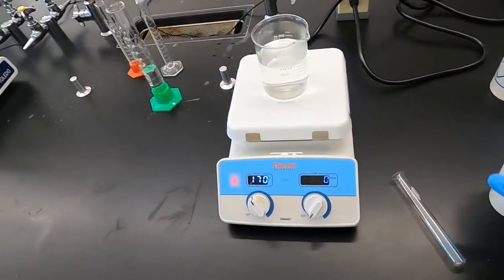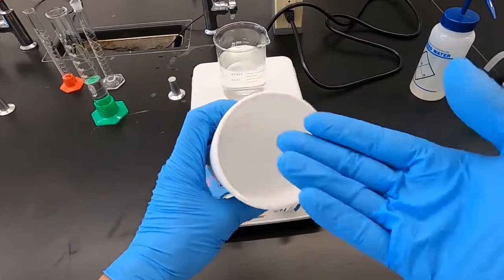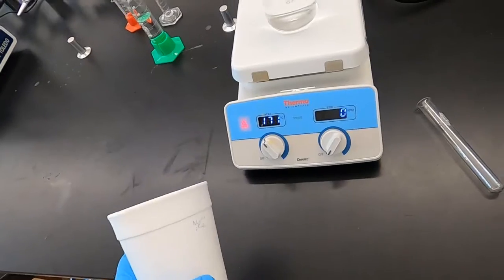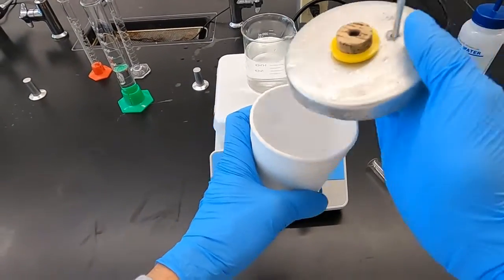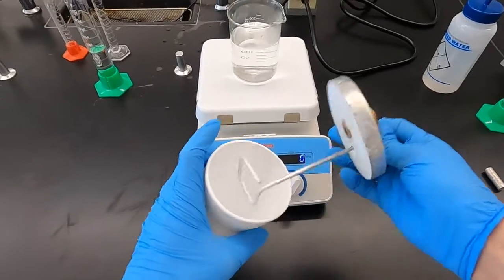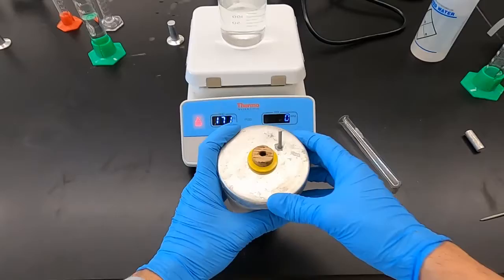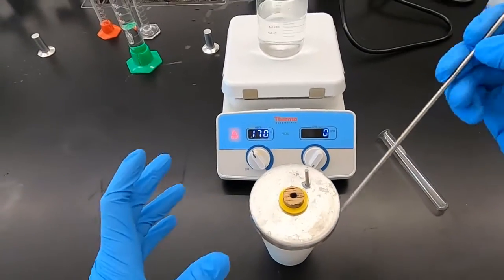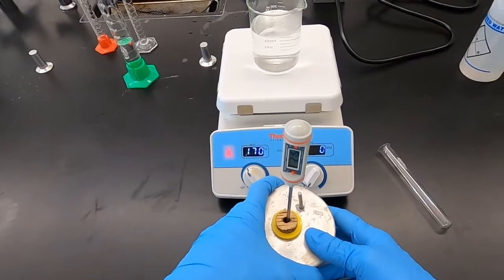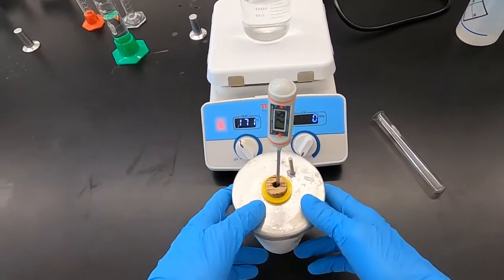So we need, to start part one, a calorimeter. So basically something to hold our solid, our liquid, and to close it off. So with this, we have a lid, make sure seal is nice and tight. I have a stirrer. This is going to let me make sure the heat flows throughout the liquid, and a thermometer to go right in the top. Right now it's at room temperature. We're going to pour some water into here and measure the temperature of that.